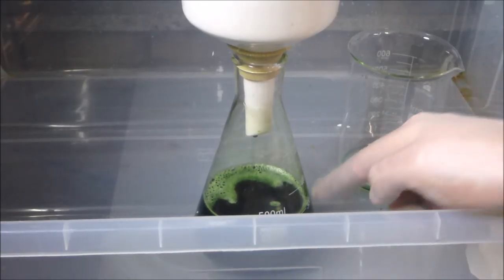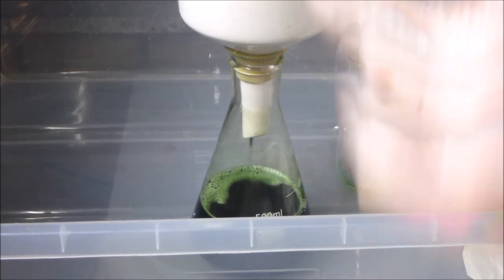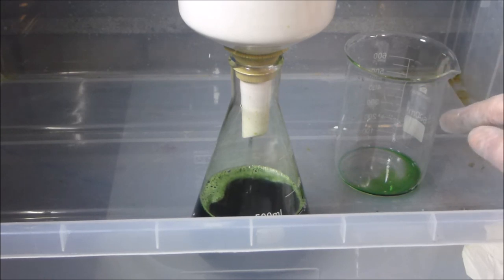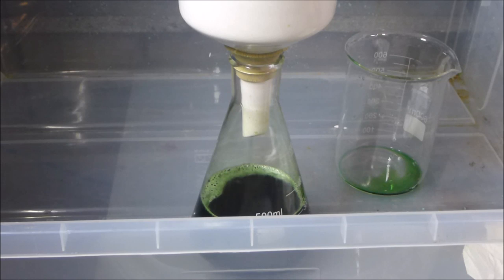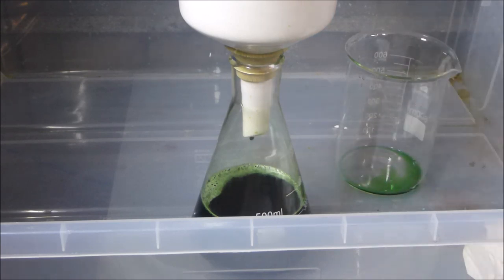Okay guys, so when this gets to the 500 milliliter mark, I will have filtered through the same filter up there already 2 liters, so 2000 milliliters of this AP solution. And it's just going a bit slow now because I've turned off the vacuum pump, but this is going way better than any other AP solution that I've ever filtered. So I've probably taken about 15 minutes since the last time I was on, and to do 2 liters of AP through the same very small filter in 15 minutes like this, and it's coming out crystal clear at the bottom, is really good.